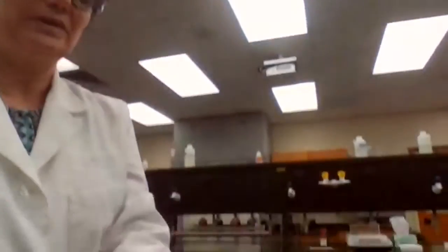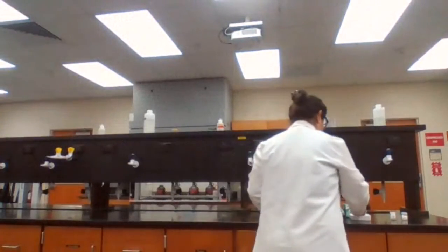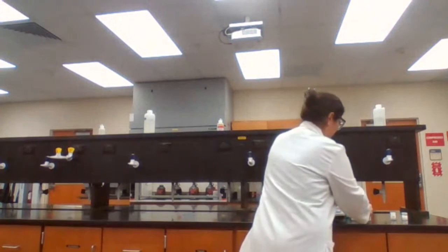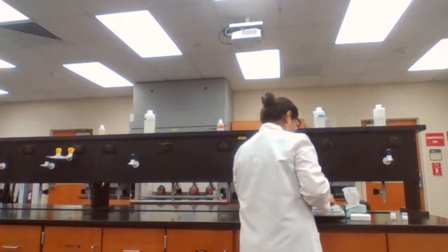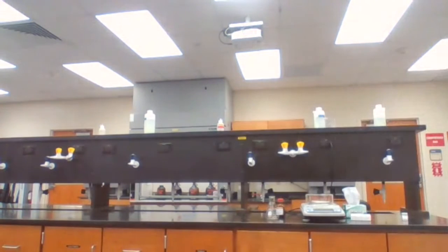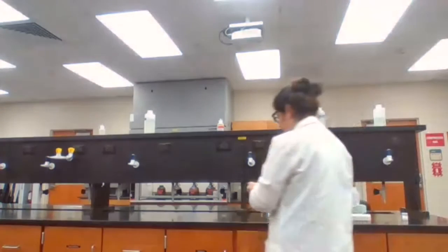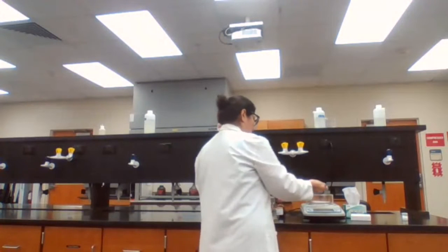Basically, you do need the data today to identify your unknown. The mass is going to be 0.2 grams. So you don't need any screenshots of the sample, of the setup or the experiment. You do need the data for final answers, final numbers.